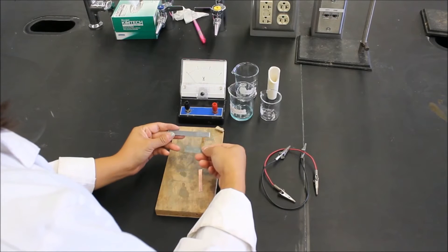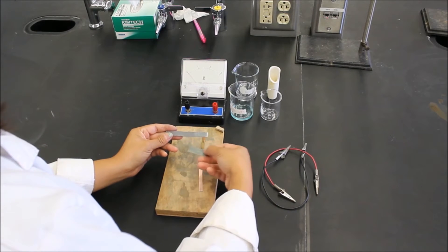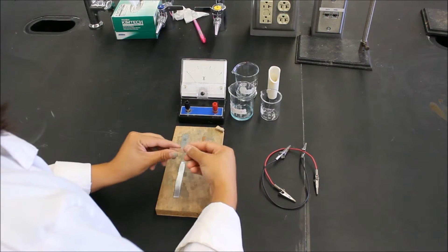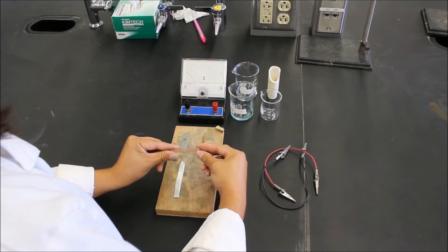Like this electrode which is dull, kind of black. You want it just to be nice and shiny. Remember, don't take too long polishing these. You may run out of time at the end of the lab.